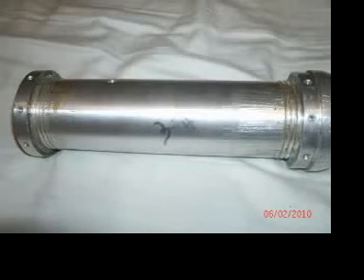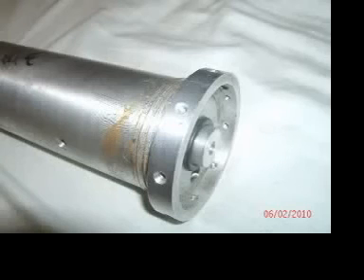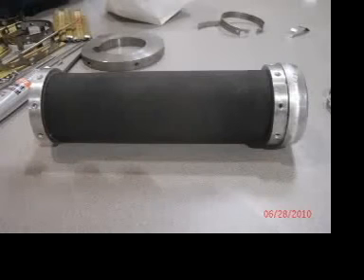You can remove the bladder from the core holder just simply by cutting it off with a pair of scissors. Remove all the old sealer from the ends. It should end up looking like this. JRC, in their infinite wisdom, did not design the core holder to come apart any further than you see it in these pictures. So it becomes a little more tricky, because now you actually have to stretch the bladder slightly to fit it over the ends of the core holder and to get it in place.